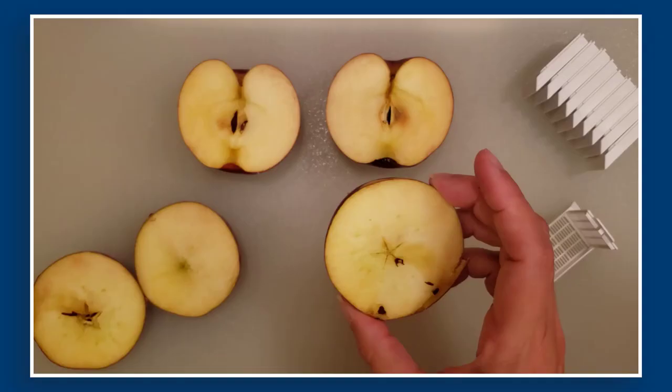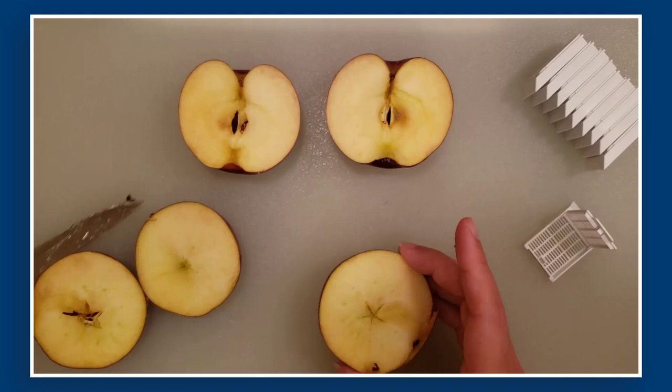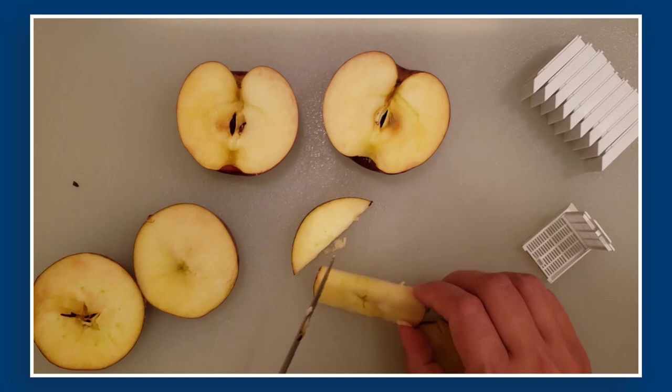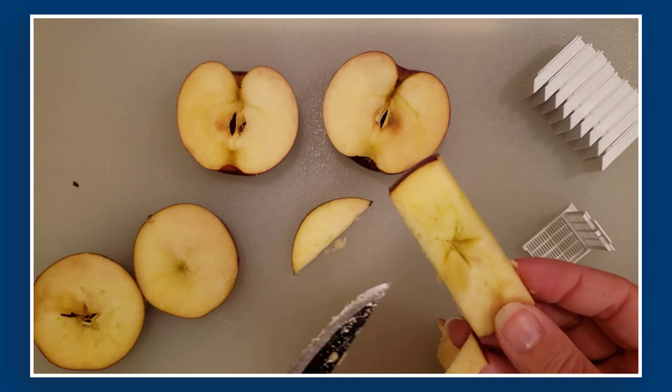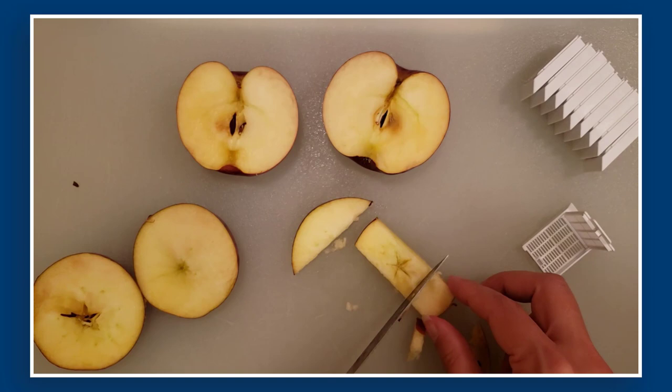Let's take a look using one of these apple slices. This looks like a pretty nice section — I'm hopeful we'll see the star shape eventually. I don't really need to see the seeds so we're going to take those out. If I'm thinking about this from the anatomy lab standpoint, I might like to see how this questionable structure relates to what I know is apple skin on the outside.